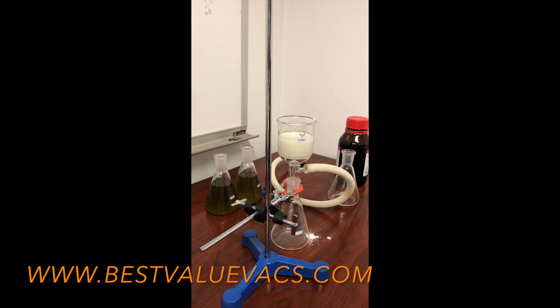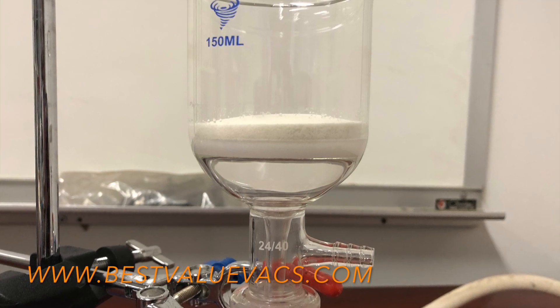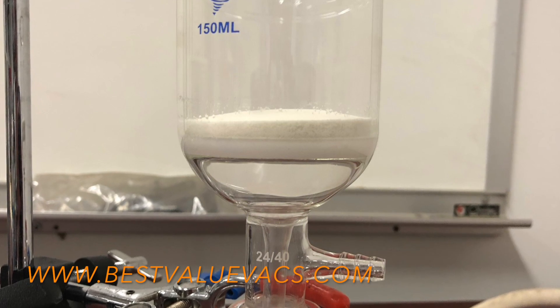What I'm going to do is turn on the vacuum pump and it's going to pull down the filter. As you can see, we have a filter layer right here. Normally I'll let the vacuum pump run for a couple of hours on this just to dry it out. You can also leave it overnight so that you can be prepared in the morning to use it.